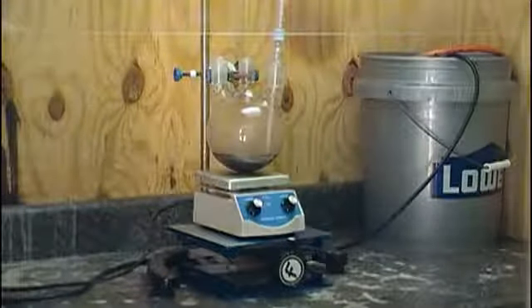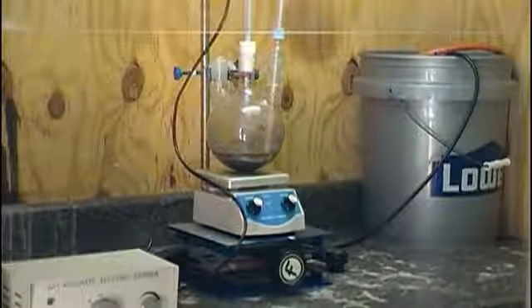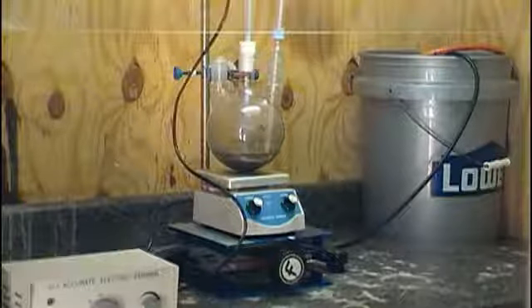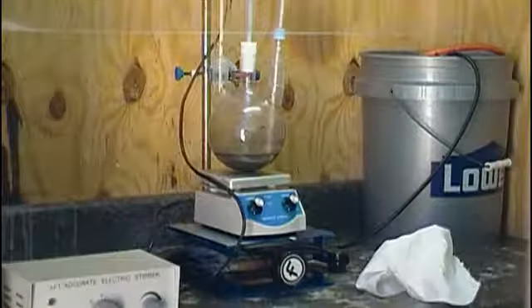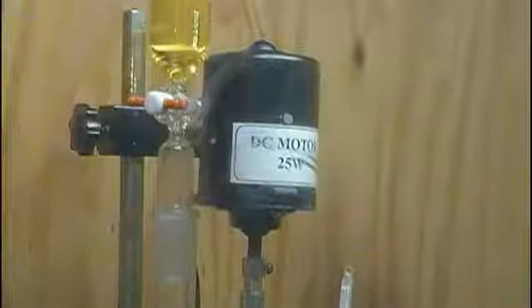Now place a thermometer and then an overhead mixer. This is one time when the overhead mixer is not optional. Mixing is very important if you want any kind of yield at all. You can't use a magnetic stirrer since iron is one of the reagents. Last you'll need to add an addition funnel with 82 milliliters of nitrobenzene. I have to use an extension to get around the motor for mine.